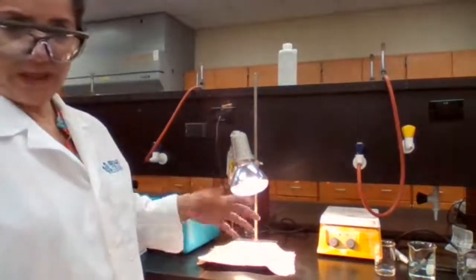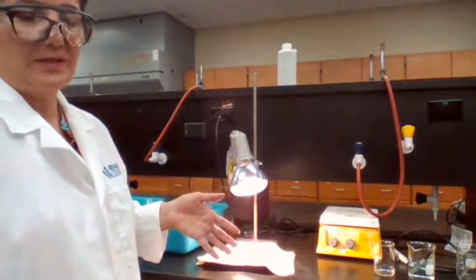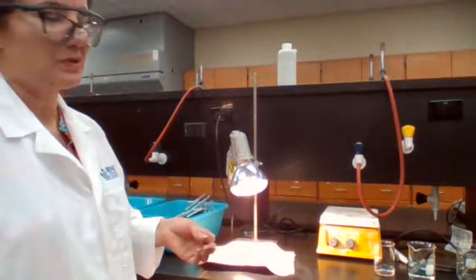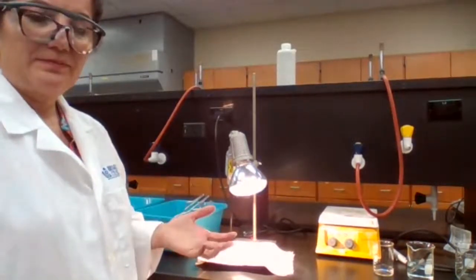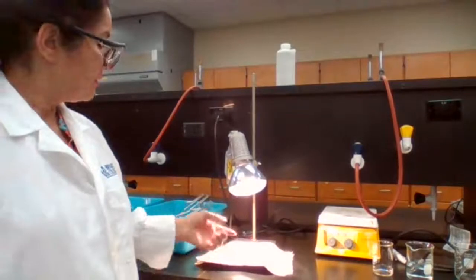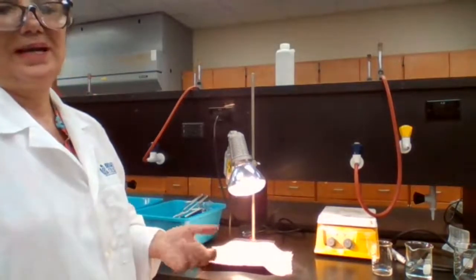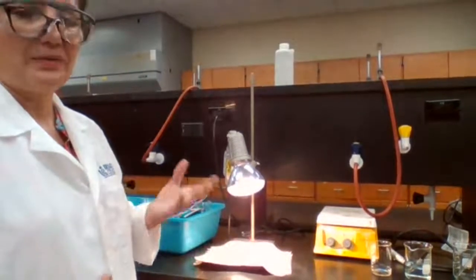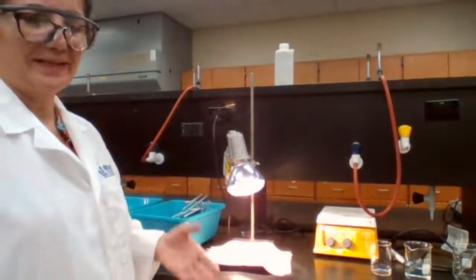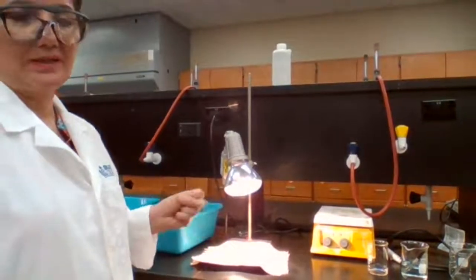I added HCl to react with zinc to make sure that there is no zinc left over. That's what the procedure is calling for. But if I don't add enough HCl and some zinc is left, what I'm measuring the mass is the zinc plus the copper. And if it's zinc plus copper, obviously it's going to weigh more. So these are hypothetical errors that can be contributing to the percent recovery.